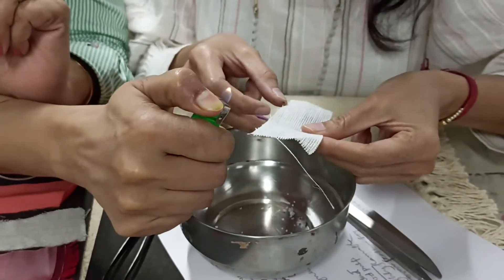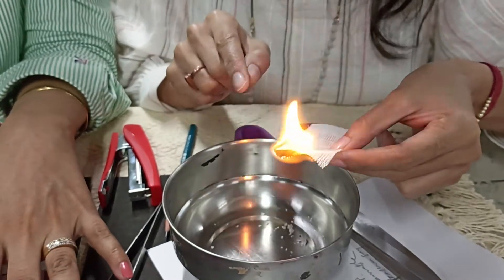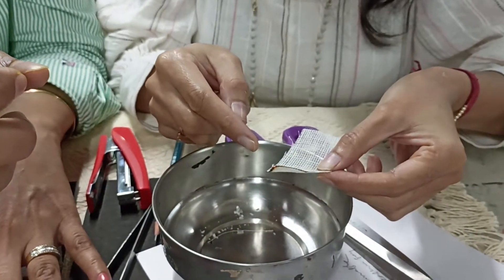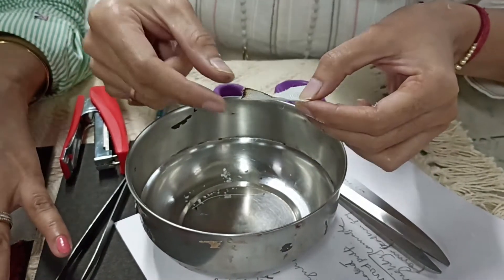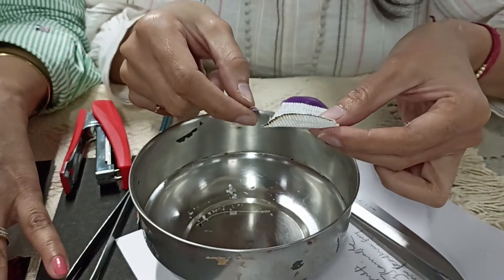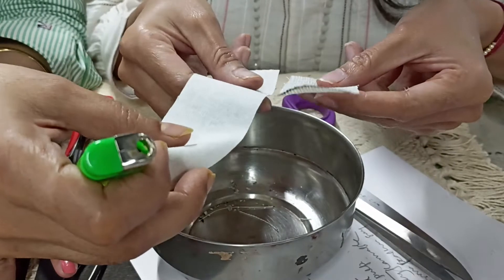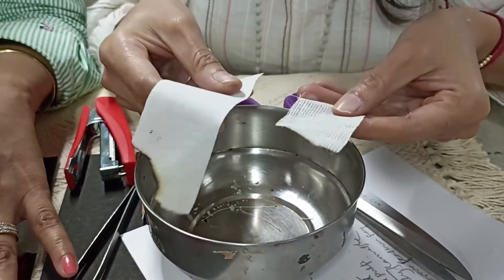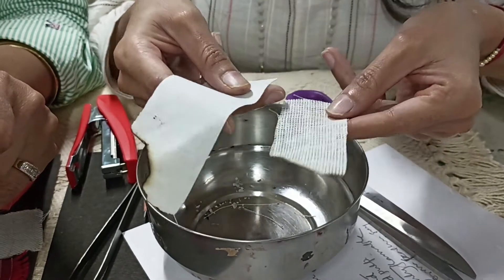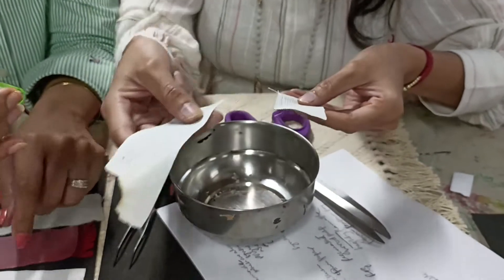Let's look at linen. This is 100% linen fabric. Being from the same source, it will also catch fire easily — non-extinguishing, meaning we have to extinguish the flame. There is an orange afterglow, the smell is similar to that of burning paper, and the residue is grey coloured ash which is soft and crushable. Students sometimes ask how to distinguish them since they burn the same way — the difference lies in visual appearance and tactile feel, which will be covered in another session. Being from the same source, the burning behaviour is similar.